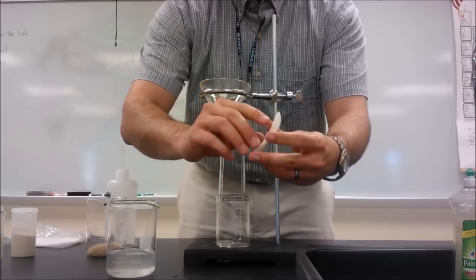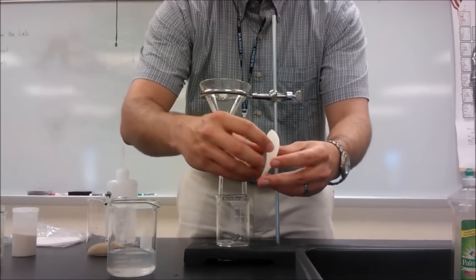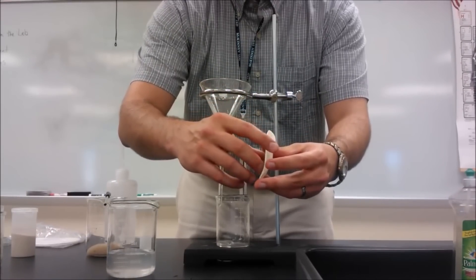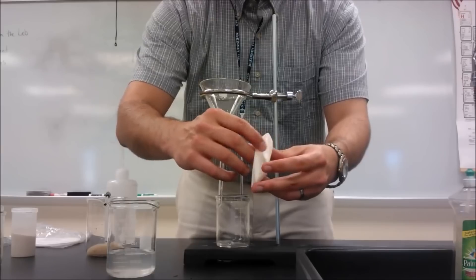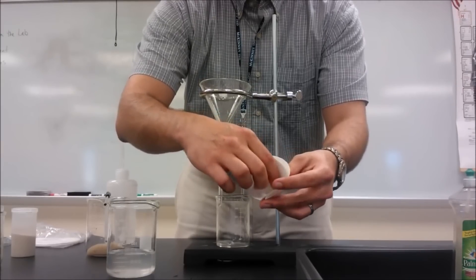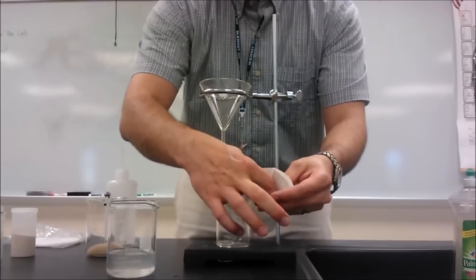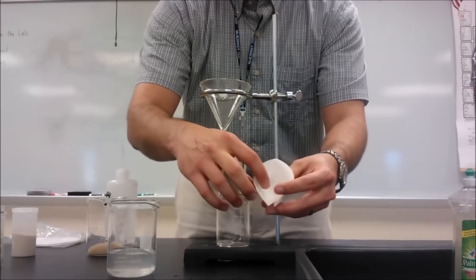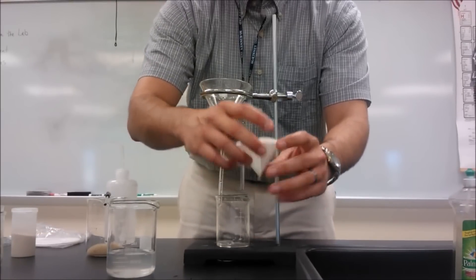And what I'm going to do is I'm going to take the first—I've got one, two, three layers that I've made, right. So I'm going to take the first layer, and notice that the first layer will give me a good cone right here. So now I just open it and it gives me a cone shape, a funnel shape.